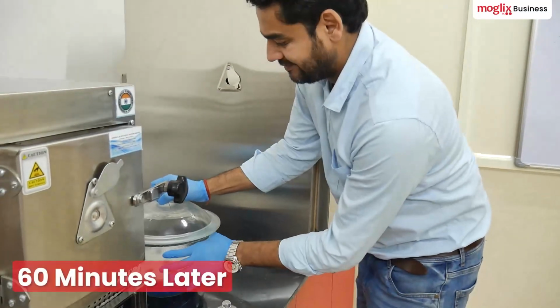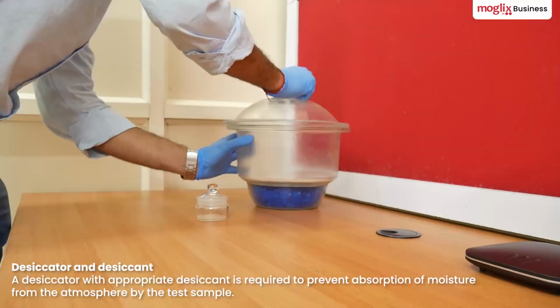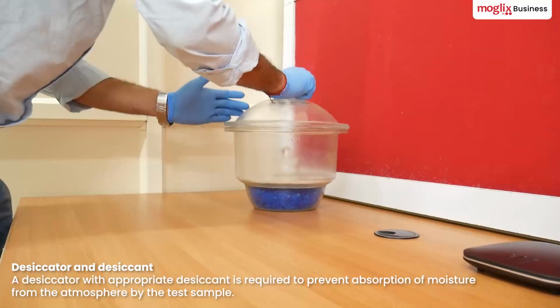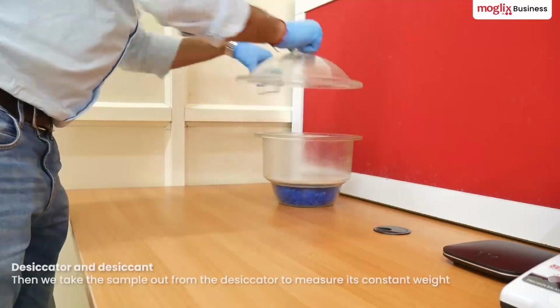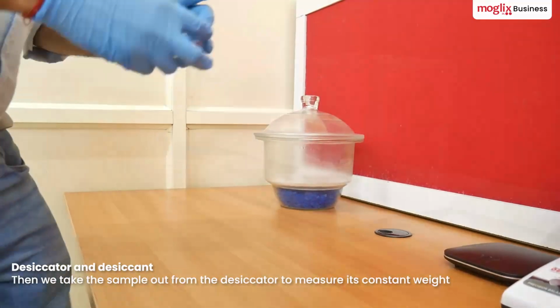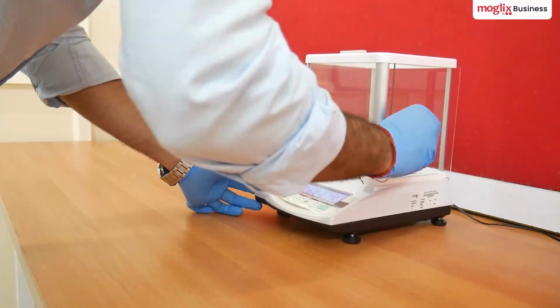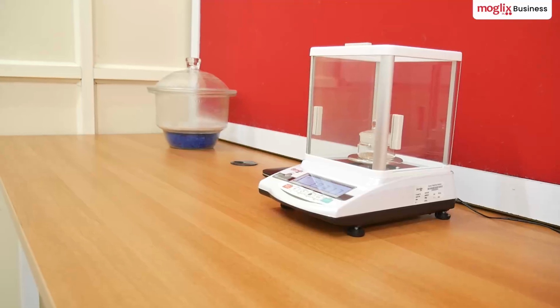60 minutes later, the sample is taken out of the oven and immediately placed into a desiccator with appropriate desiccant to avoid any moisture addition from the environment. Then we take the sample out from the desiccator to measure its constant weight. Once the weight is measured and noted down, we take out the sample for the next test.